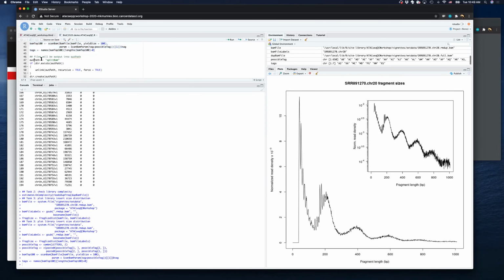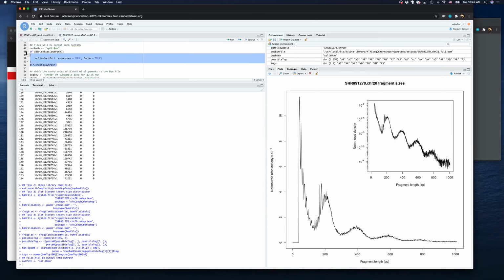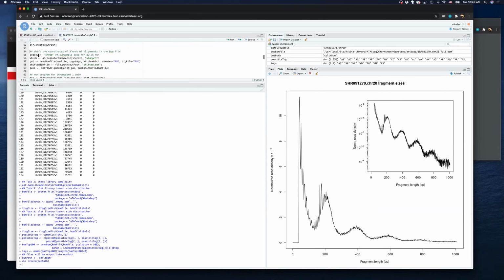We set outputs to save the split BAM. This one is just in case you already tried this script. And then the seq level is set because this sample file only contains chromosome 20.